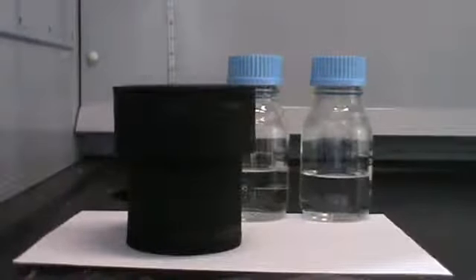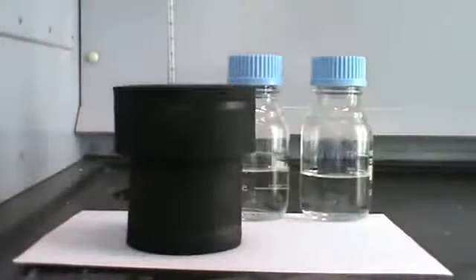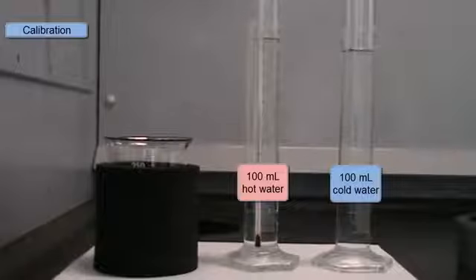The problem is, though, that even though the calorimeter is insulated, some heat will still escape through the walls of the calorimeter. It's not perfect. So we need to first of all calibrate the calorimeter to see how much heat will be lost through the calorimeter. So in the calibration step, we'll take 100 ml of hot water and 100 ml of cold water.